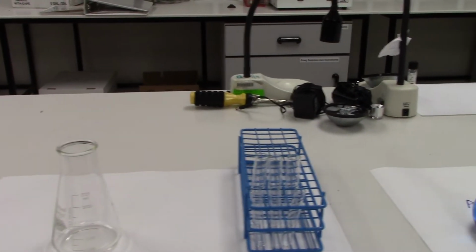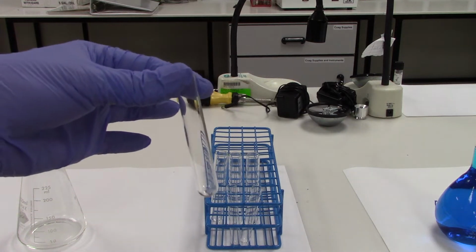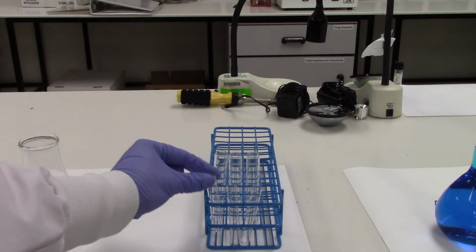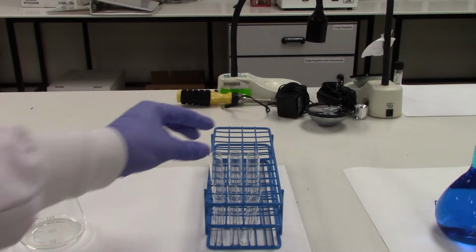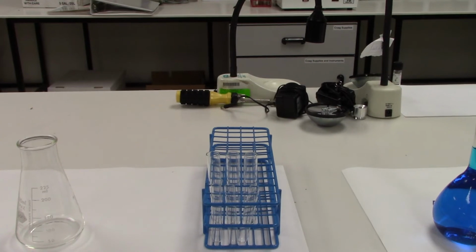Station 5 shows us several variations of a test tube. Test tubes are usually made of glass and they are disposable. There are smaller test tubes that are used for some types of testing in the lab, and larger test tubes that are used for other types of testing in the lab. They are also used for holding liquids. You can tell that there are no markings along the side of them, so they are non-volumetric and they are not precise. They are simply going to be used to hold or move smaller volumes of liquid from place to place in the lab.